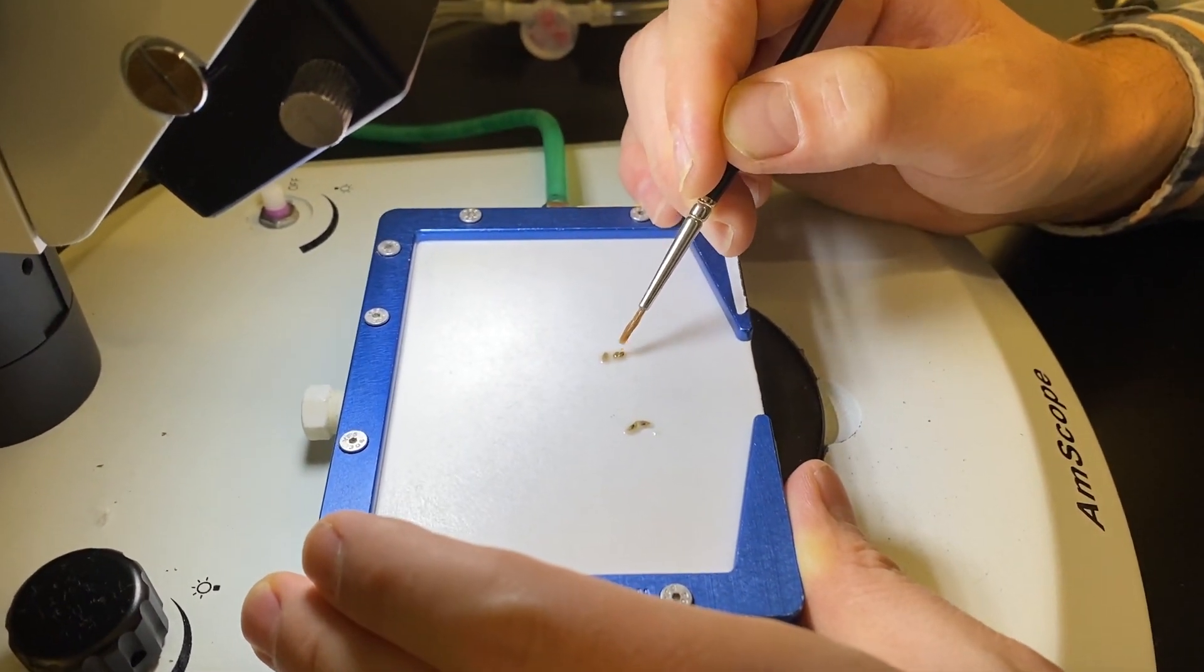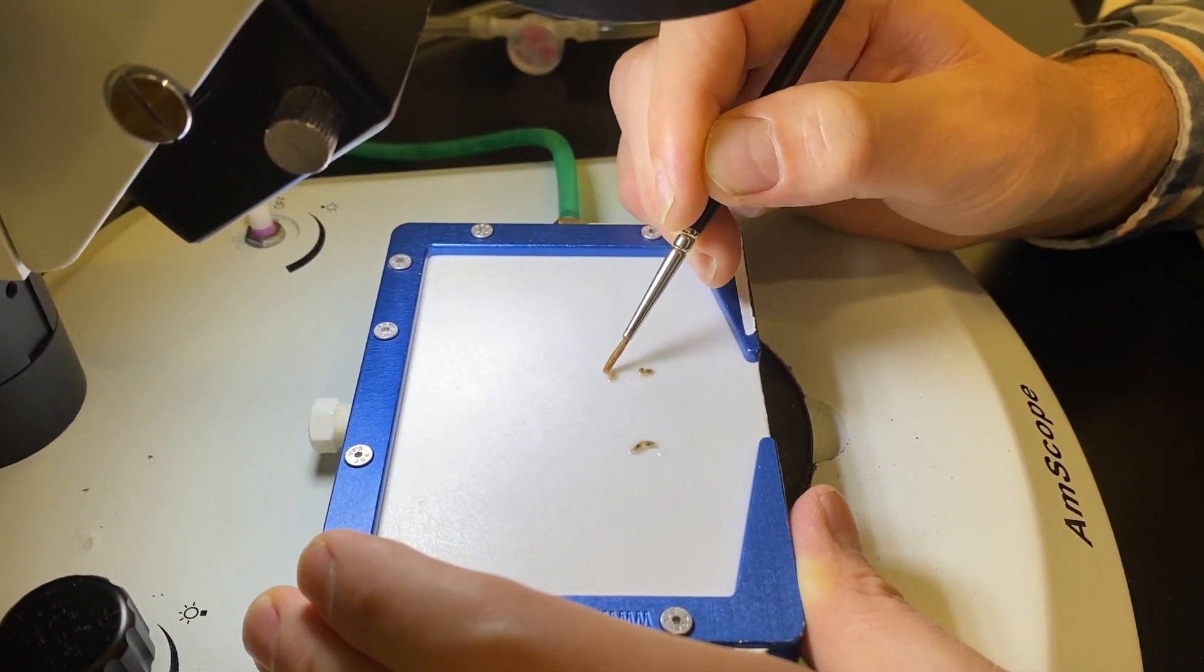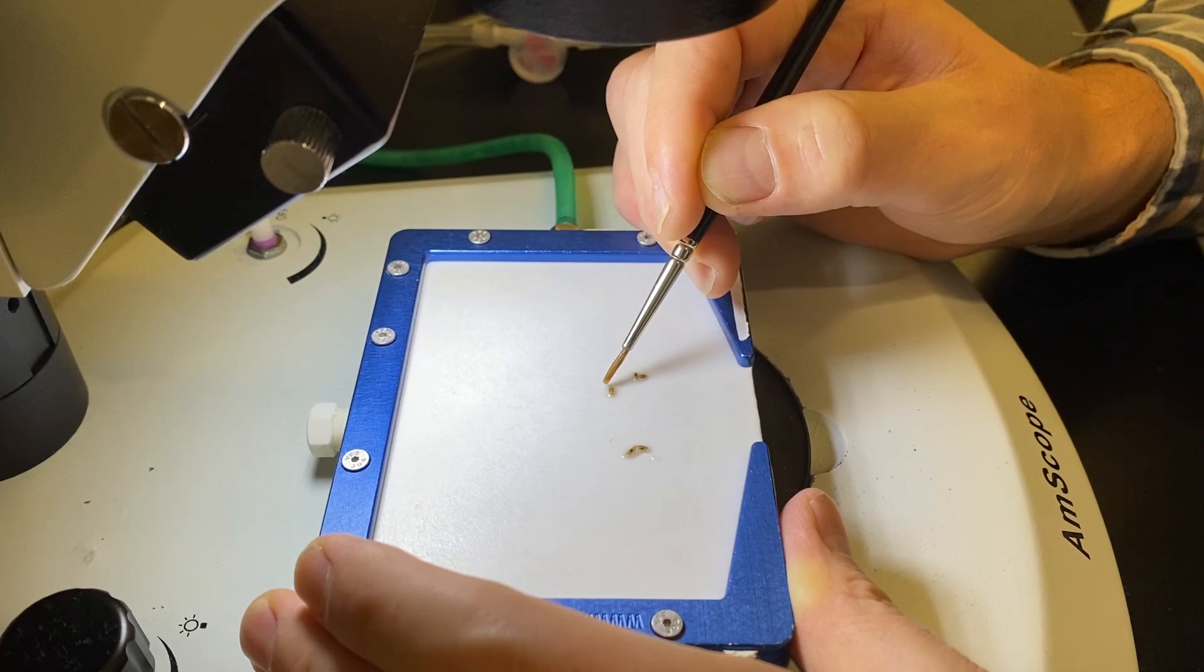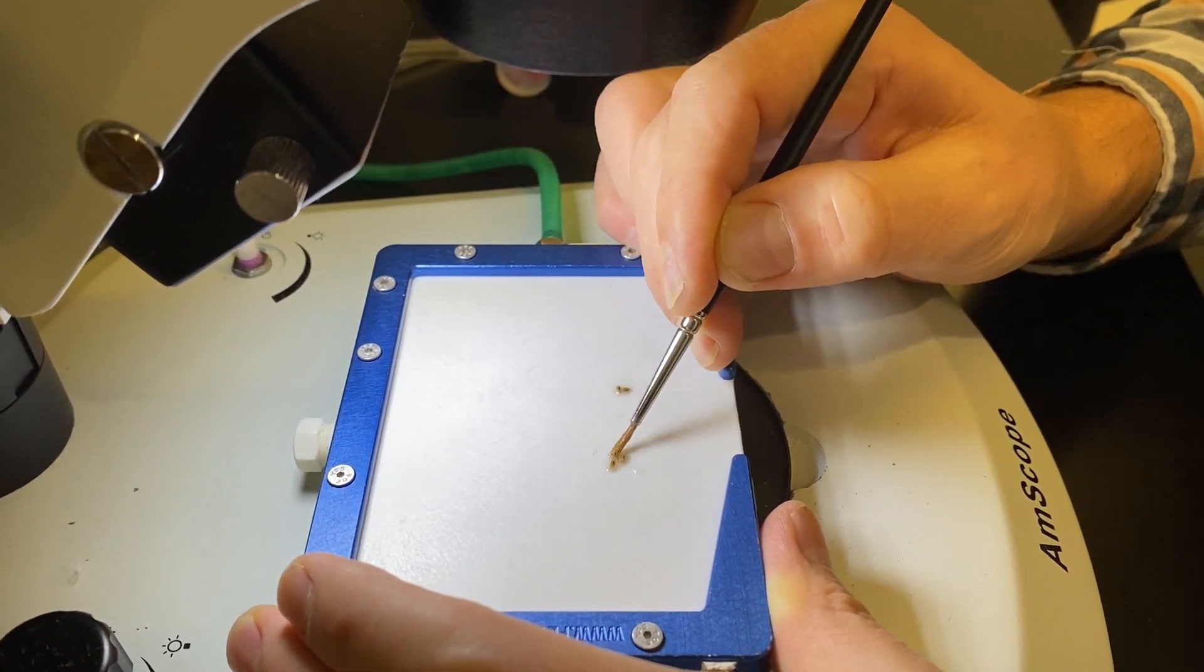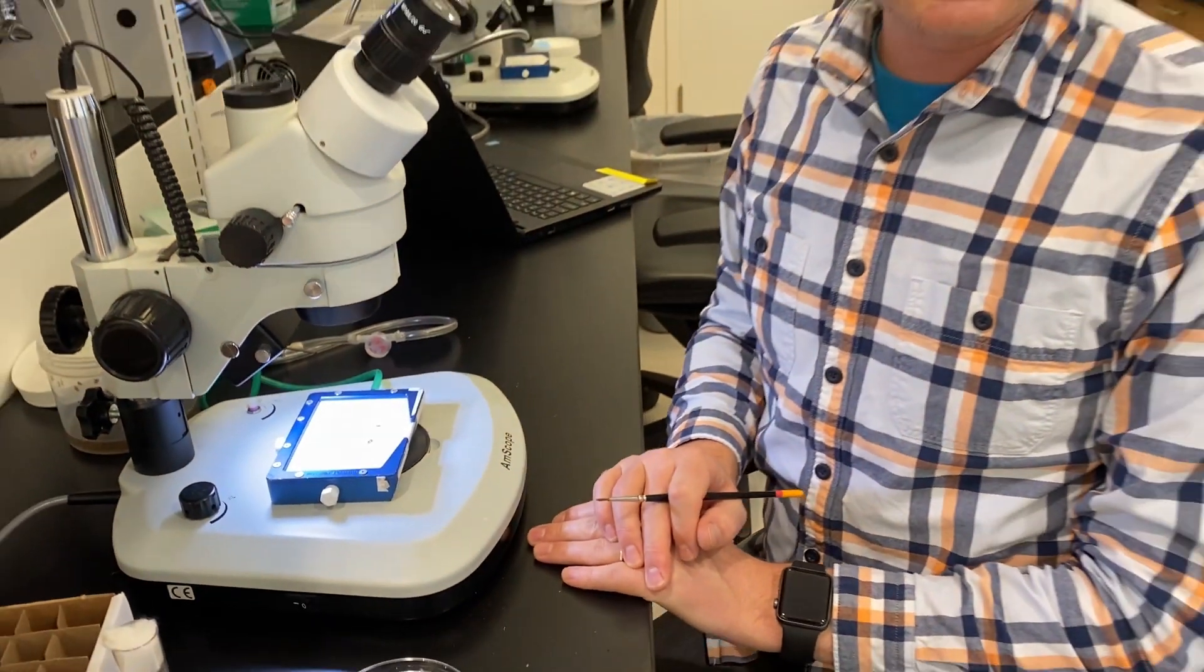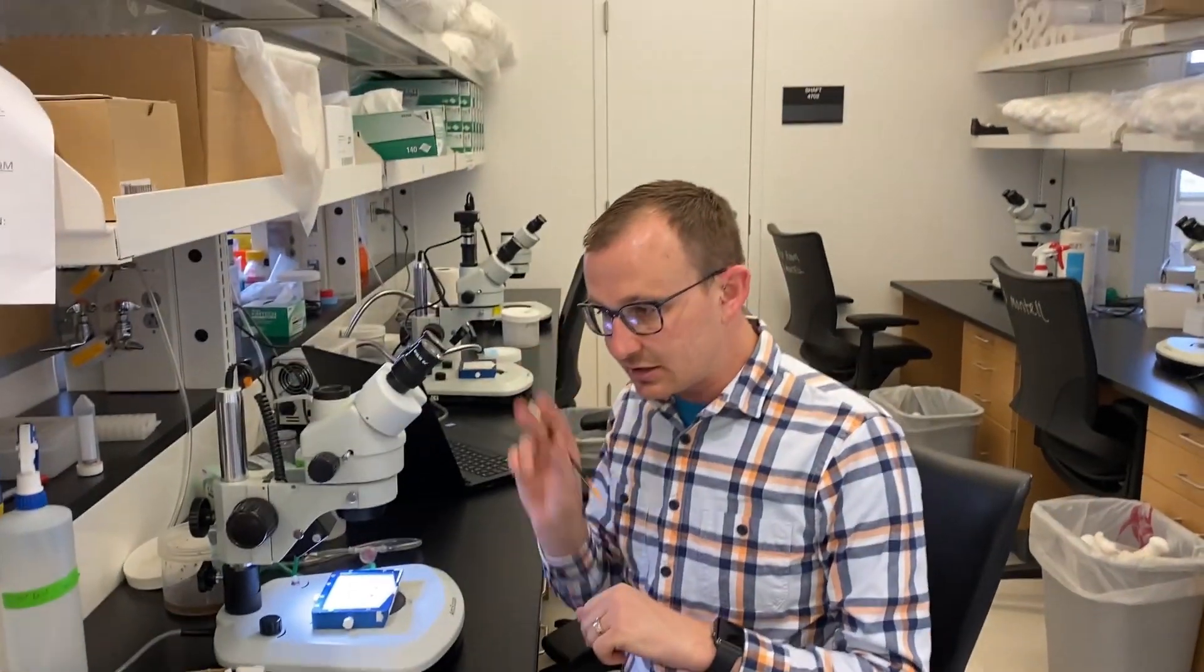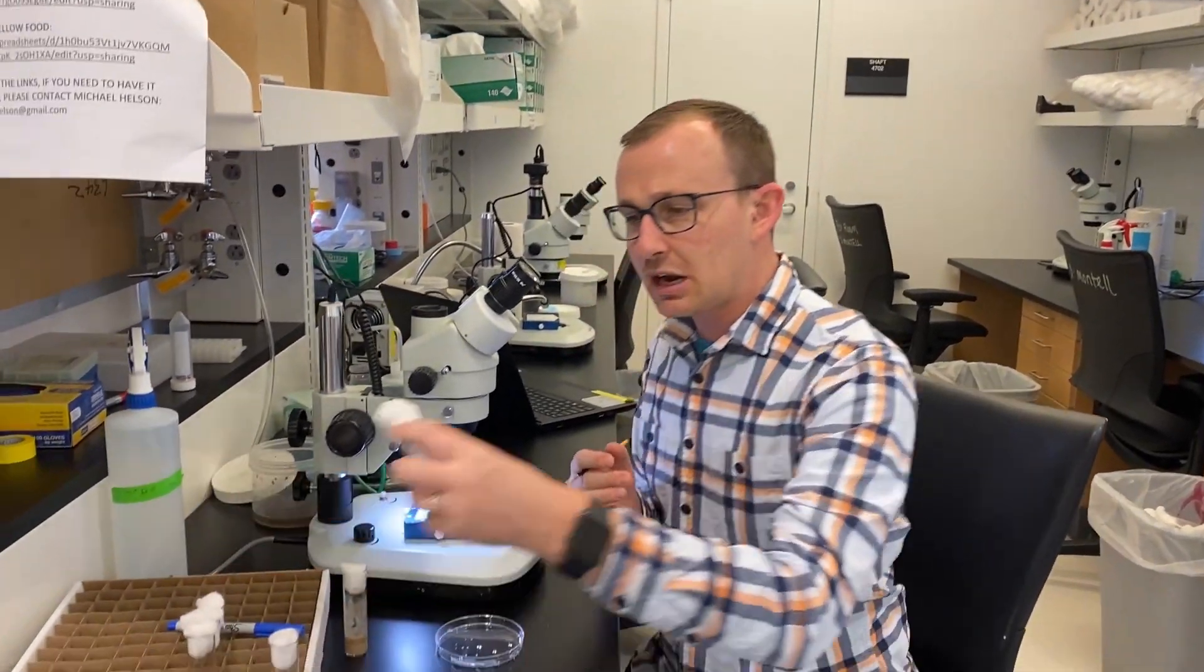So there are two virgins. There's a nice beautiful male, and another virgin. So that quickly I have selected two males and a virgin. We will go ahead and show you what this looks like under the microscope in just a second on the second microscope. But I want to show you how to now segregate these males or get them back into brand new vials.